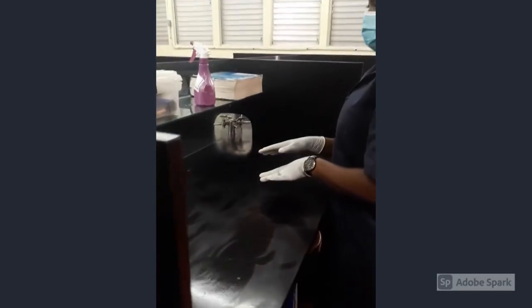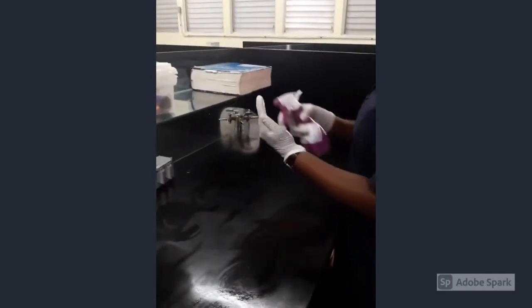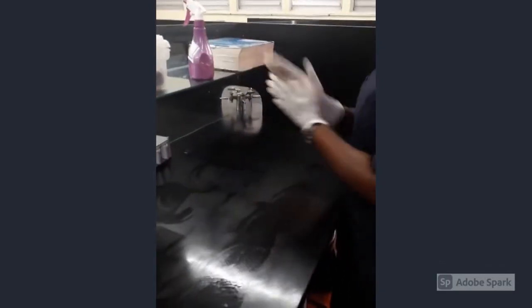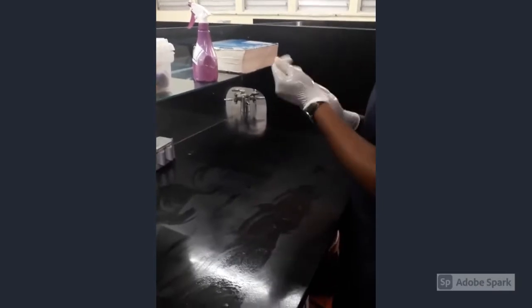Right after coming from the bin, she's going to use the same 70% alcohol to sanitize her hands again, just to ensure that they're free from germs or anything.